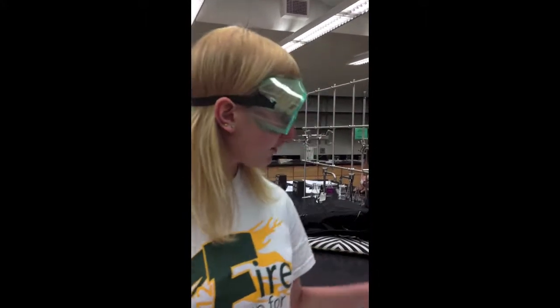In each of our trials, we're going to do 3 trials. In each of the trials, we have an indicator solution that allows us to see a change in color every time a drop is added. And so we continuously swirl it to make sure it's evenly distributed. And near the end of the experiment, like we are now, when the titration point should be reached, we slow it down so we can clearly wait for the distinct color change. We want it to turn a light pink.